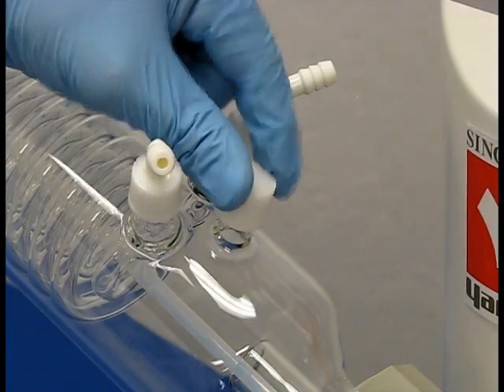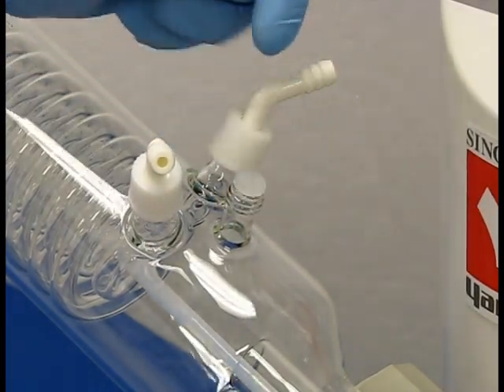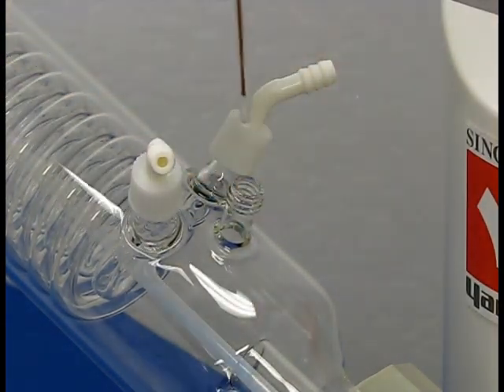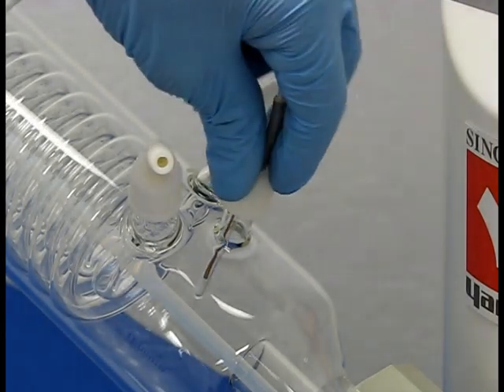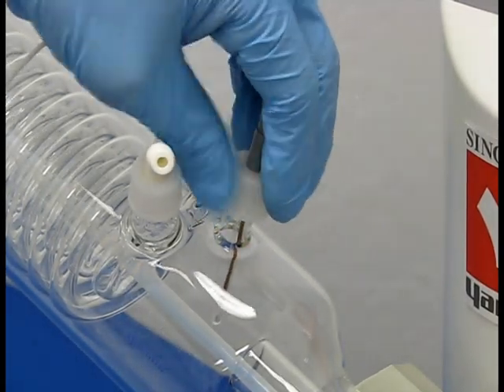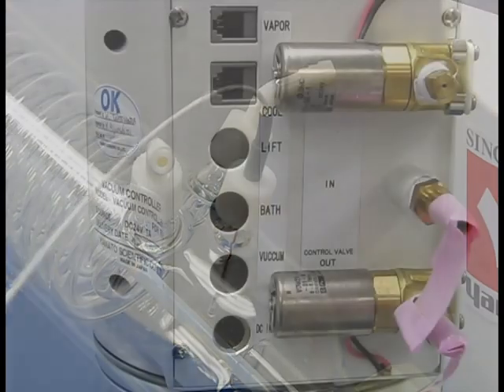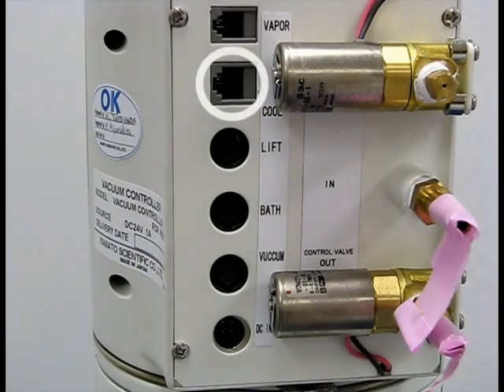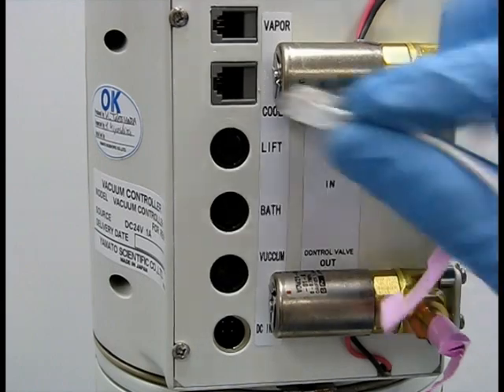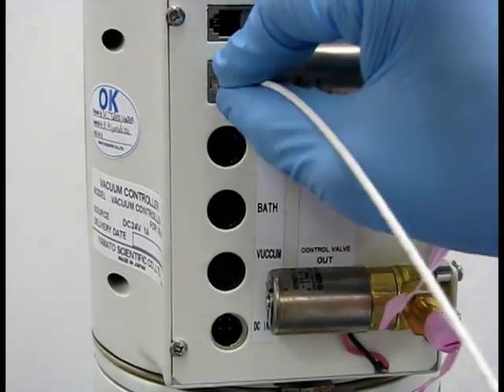Remove the stop cap and seal from the condenser and fasten the cooling temperature sensor to the condenser. Take the connection of the sensor and plug it into the cooling temperature sensor terminal at the back of the vacuum regulator.